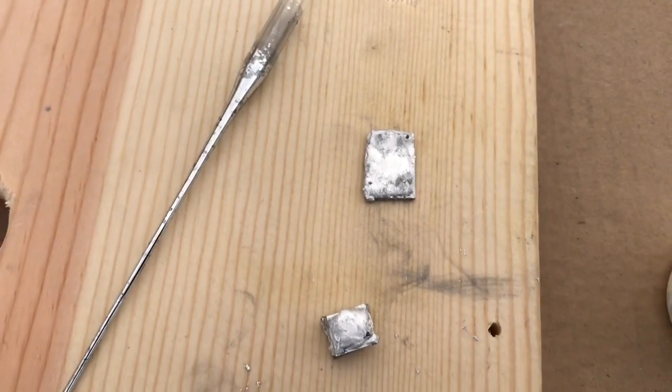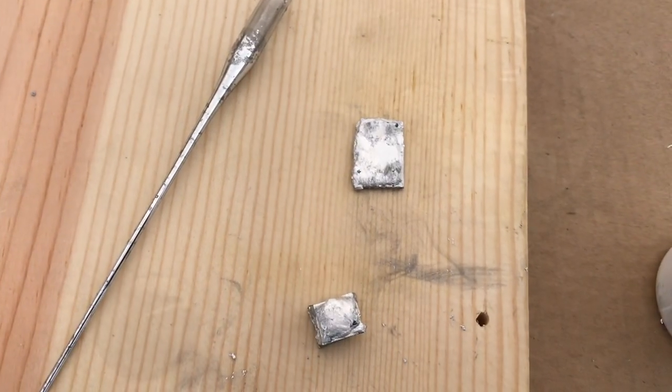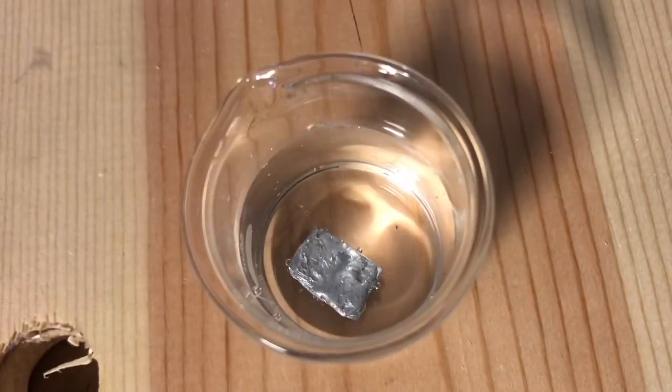Here we've got some water. The gallium has been on the aluminum for a couple of hours, so we're going to throw it in the water and see what happens. It looks like it's starting to react.